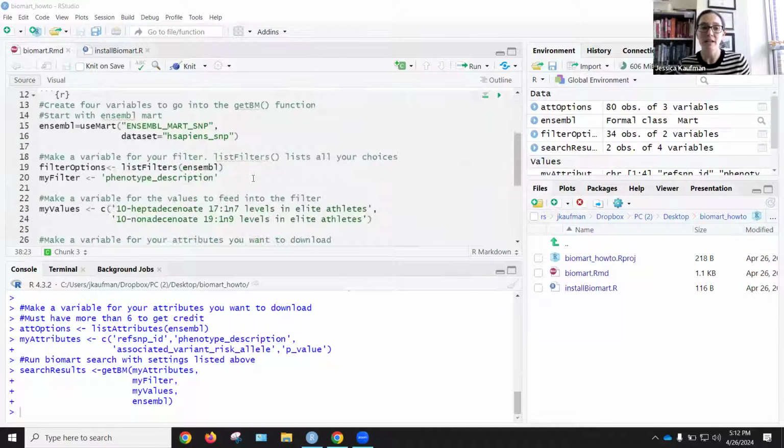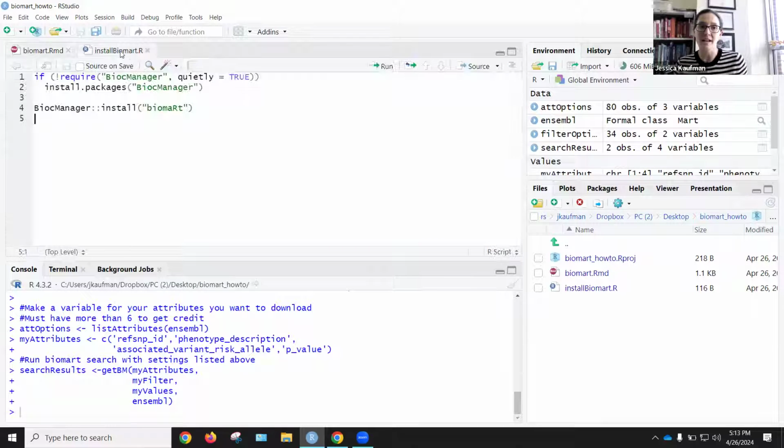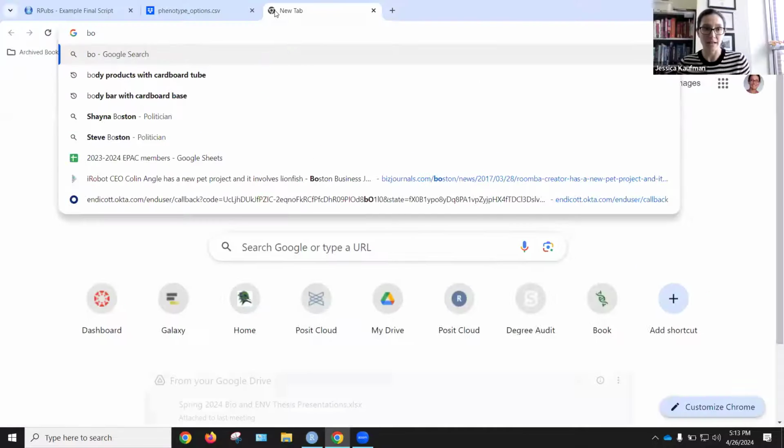When we run the biomart tool, the only way we're able to run this function right here, getBM, get biomart data, is if we have successfully installed the biomart package from Bioconductor. It takes a really long time to install this package. So one thing I've done for myself to make sure that I only install the package once is I've set up a separate R script for the little code snippet from Bioconductor. I've copied this directly from the Bioconductor website.